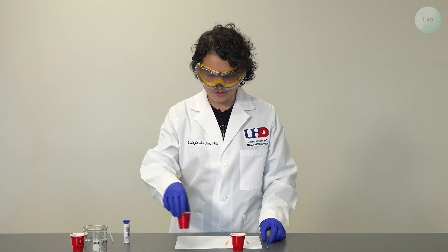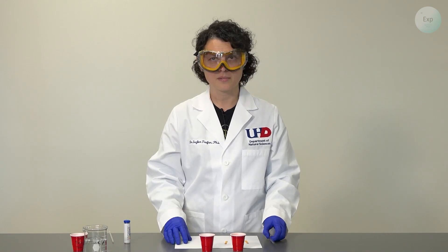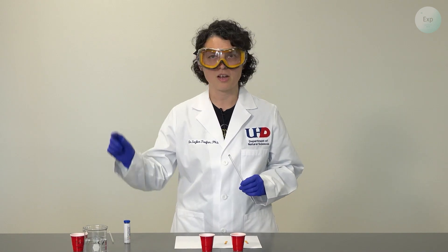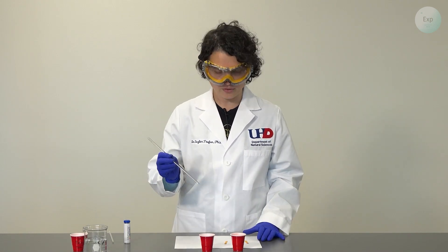For the next measurement I am going to use my vinegar and I am switching between glass stirring rods but you could just take your stirring rod, dip it in water, dry it, and move on to the next experiment.